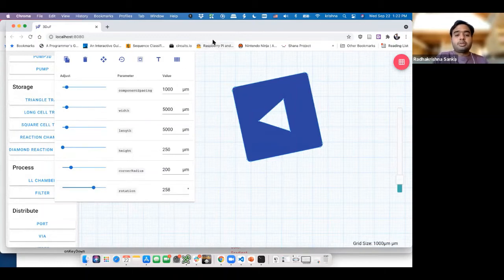So what we were able to do, in a matter of like half an hour with me explaining how to do all these things to you all, is quickly create an entire new component and add it to 3DuF.